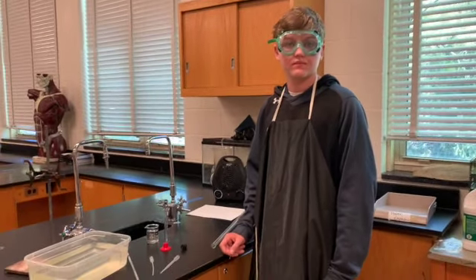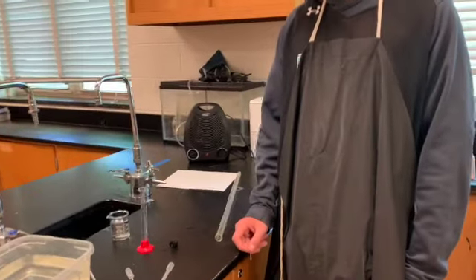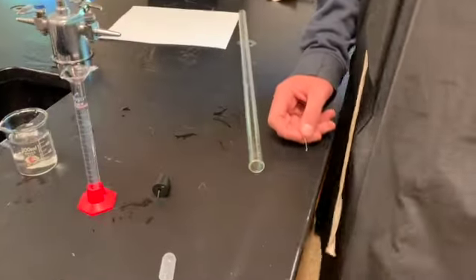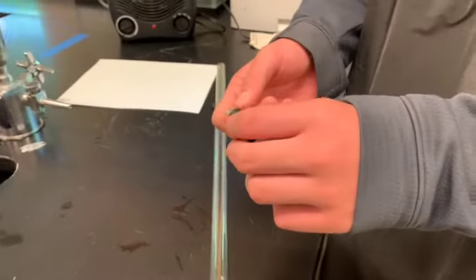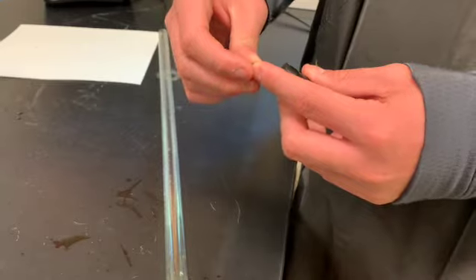All right, so now we are actually in a lab at Whitman, and we are going to show you how to do this reaction. So the first thing Maurice is going to do is take that magnesium ribbon that we already know the mass of. He is going to attach it to the end of this stopper. You just fold it once, and that's good to go. You can just leave that.